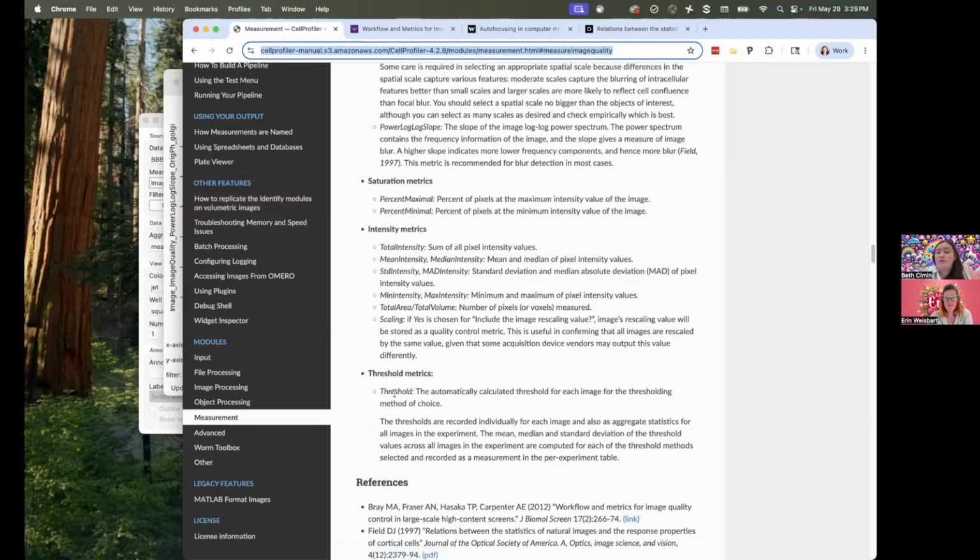Threshold metrics. Cell Profiler can calculate the thresholds as part of the Measure Image Quality module for a bunch of the different thresholding methods that it uses. Again, no individual threshold is wrong, but it can help you see if there are patterns where the thresholds are consistently different for a particular set of images, where is the threshold being set?